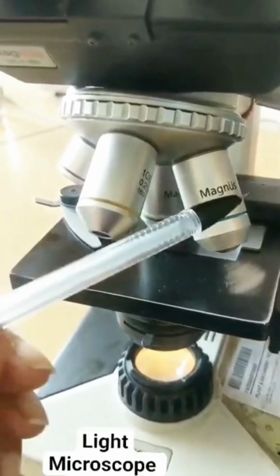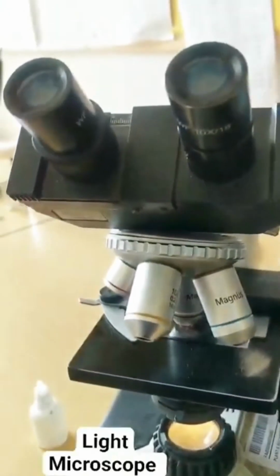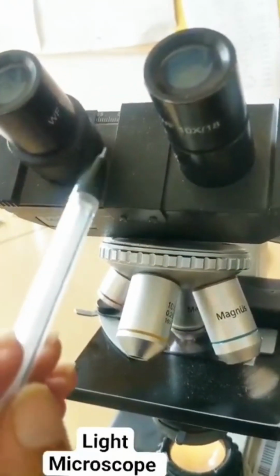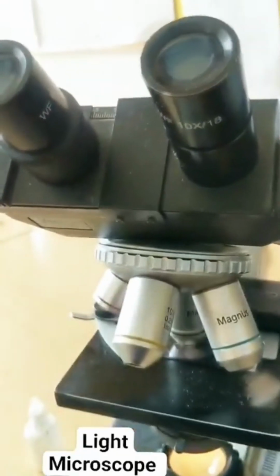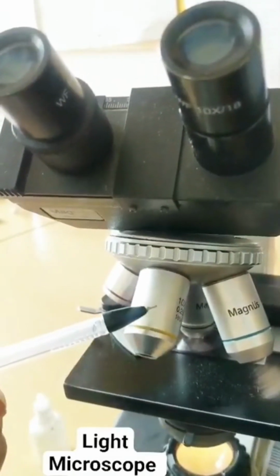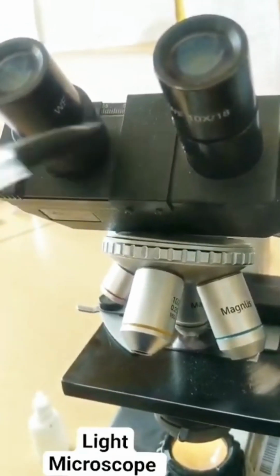Finally, after the objective lenses I've explained to you, you have this last one from where you're viewing. This is a binocular vision. You can adjust it as per your intercanthal distance. And what is the magnification written on this? 10x. This is the eyepiece. The final magnification that you get is the objective lens that you are using multiplied by the eyepiece, which is always 10x.